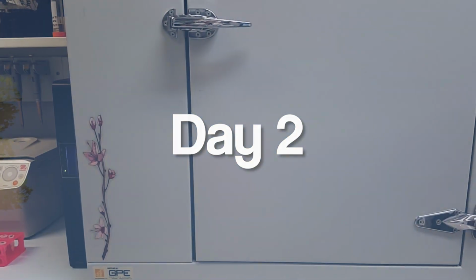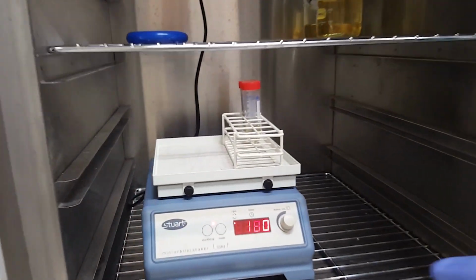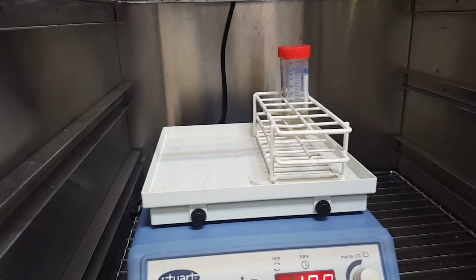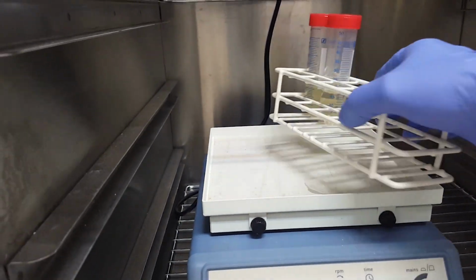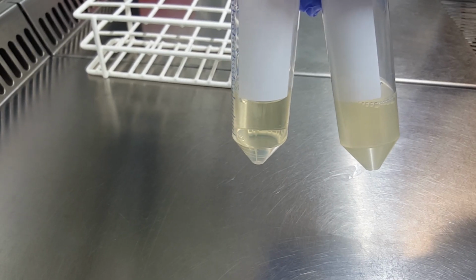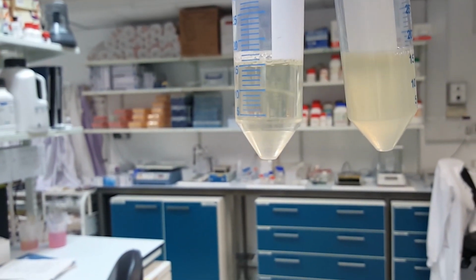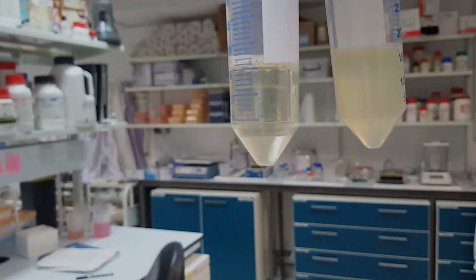Returning the next morning, collect your tubes from the incubator. There should be visible growth in the culture tube, and the media-only tube should be clear, as it was the day before. If it's not, then that means that some contamination is present, and we can't be confident that our culture is what it should be. If that's the case, we would have to start again.